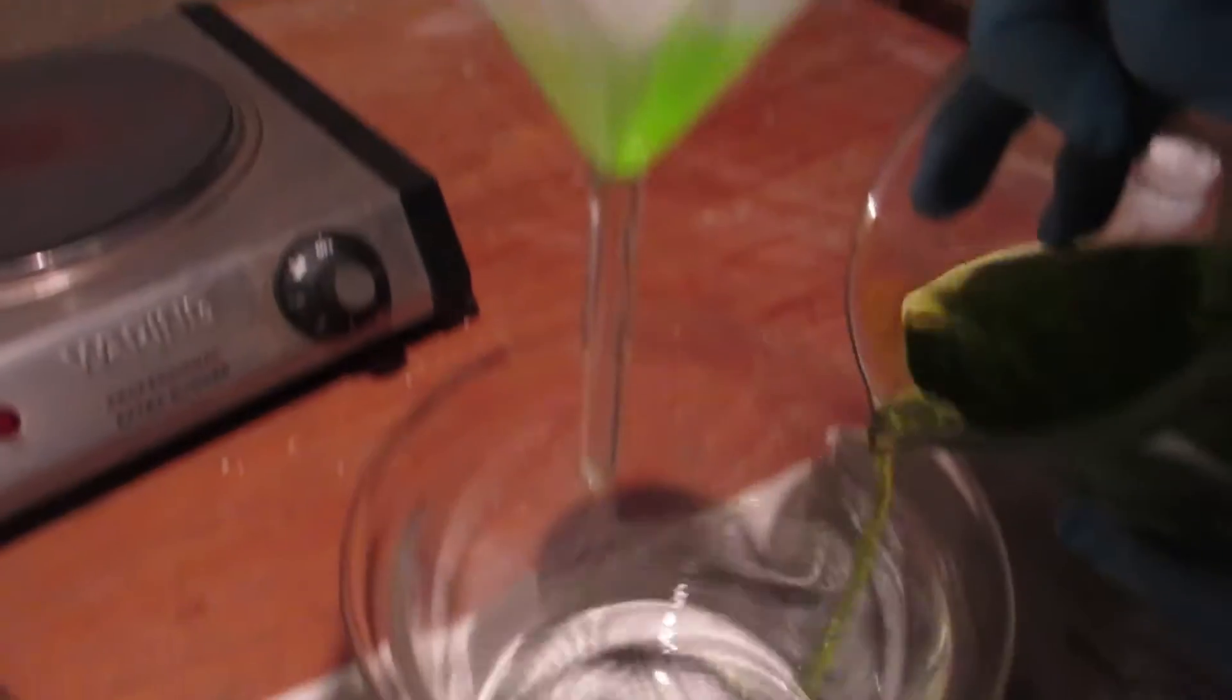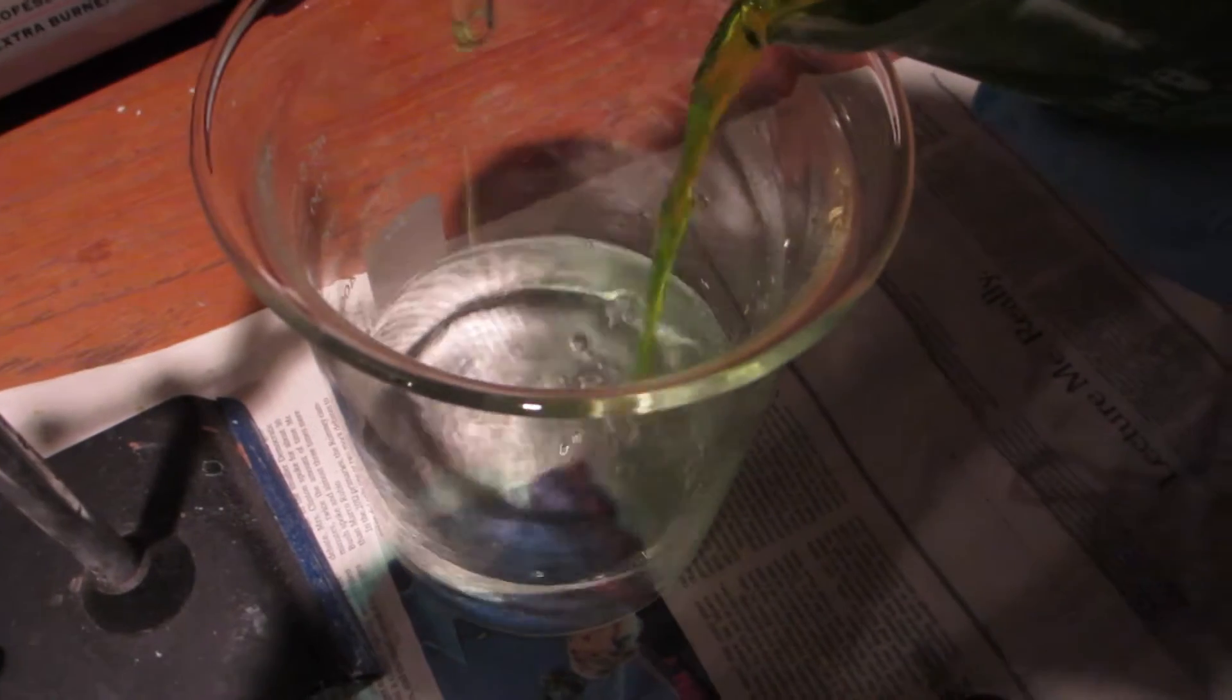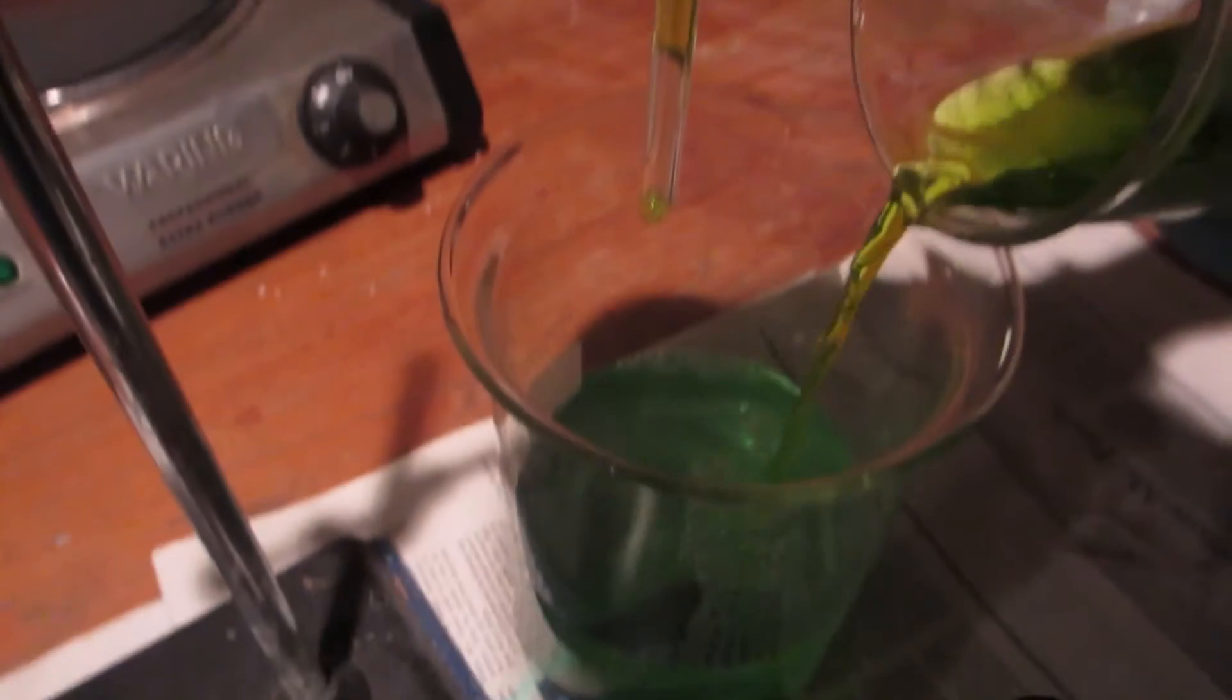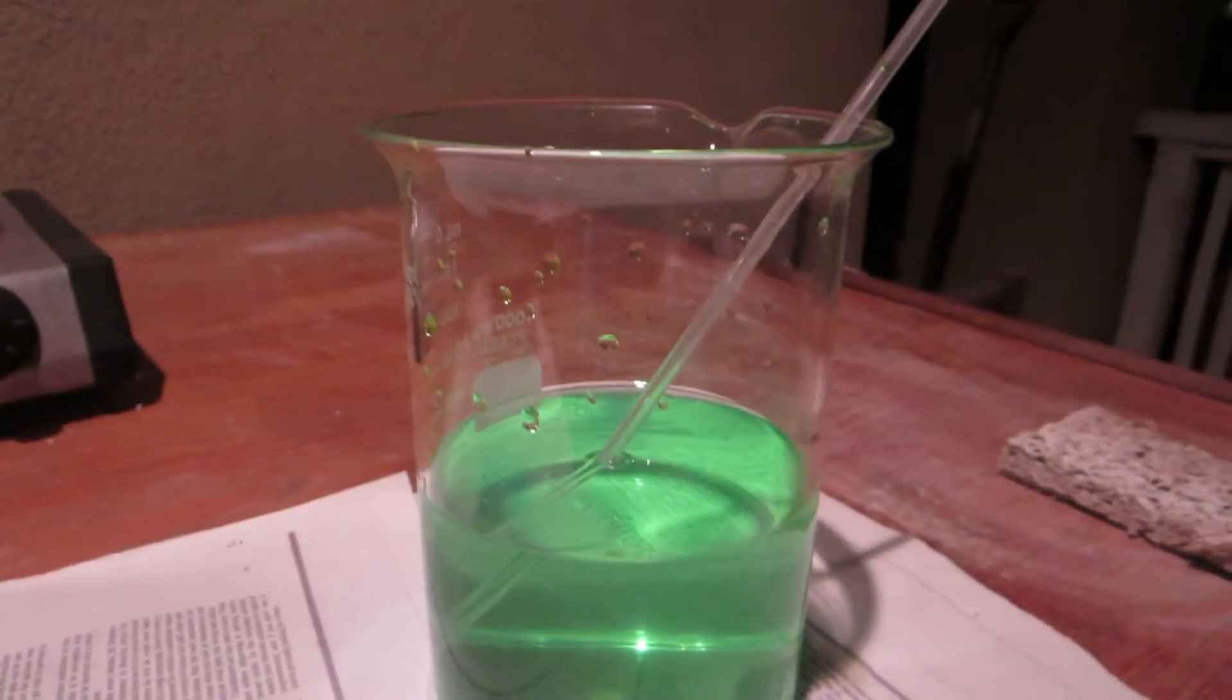Now we're going to precipitate the gold by adding sodium bisulfite.